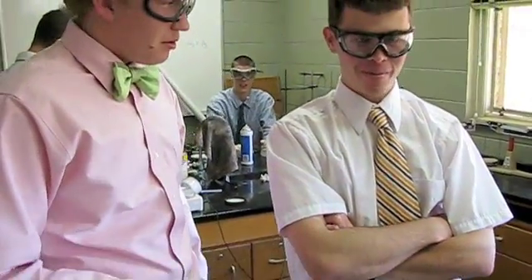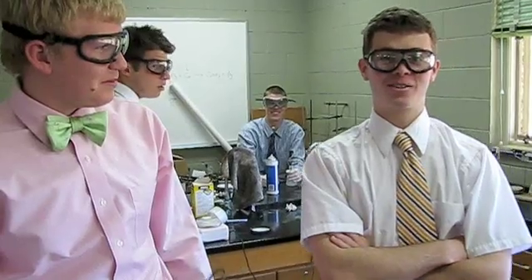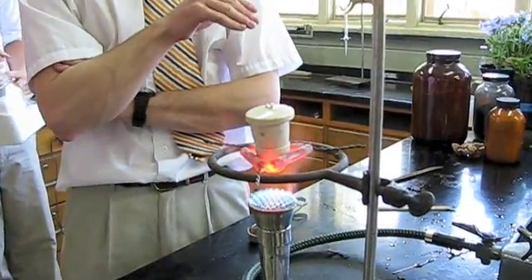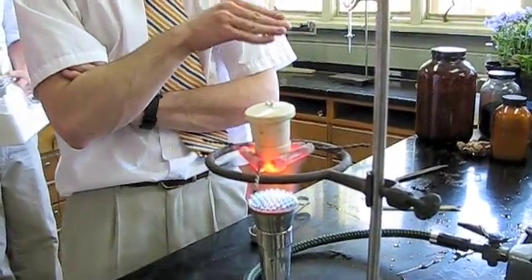What are we doing here, guys? We're making iron. You're making iron from what? Ferric oxide, calcium oxide, and charcoal. Okay, so we're doing the reverse — a non-spontaneous reaction. We're converting rust back to its original iron. How are you going to do that? We're hoping that by heating this and replicating a furnace that's used to make iron and purify it, we think that we might be able to make iron.